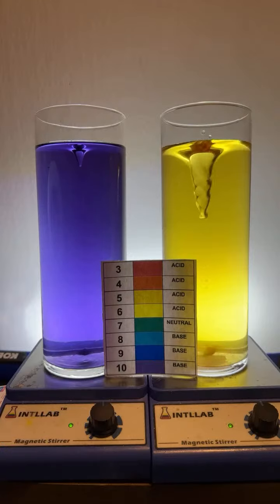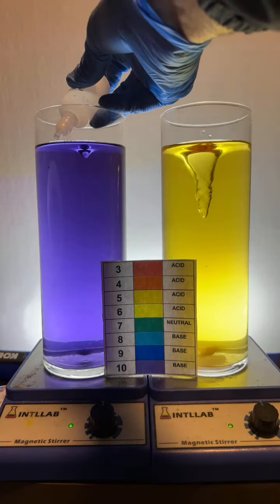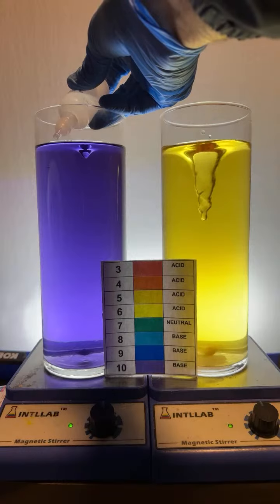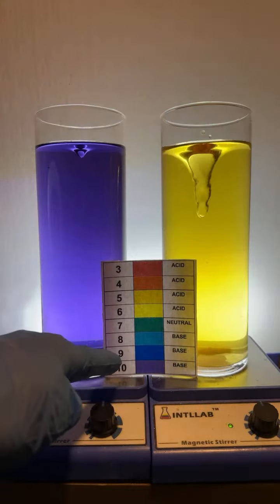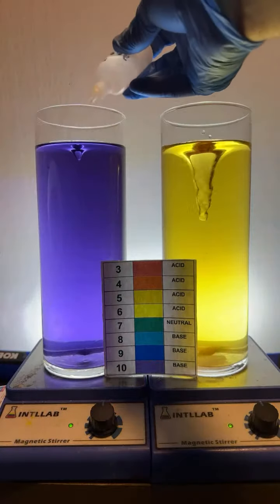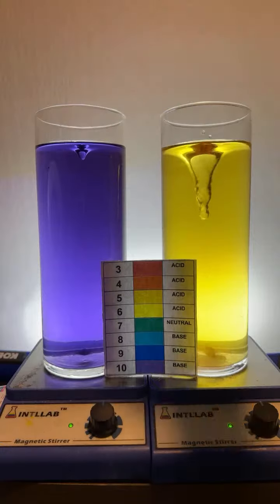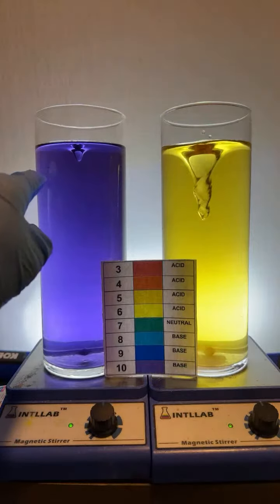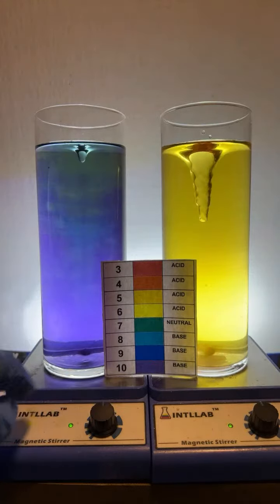Casting spells. Not casting spells, just doing a little science. Can I make it stay purple? Well, I got some purple over here for you, Denny. Here we go. I'm going to try to add just a little bit of acid here to drop this from a pH of 10 down to 9 to try to get it to blue. If you'll watch up here, what I try to do when I add a bit is I just add a drop. See that? I just added it to the side, and as it sinks in, it's just a little bit of acid. We'll see if I can get this to change to a blue color.